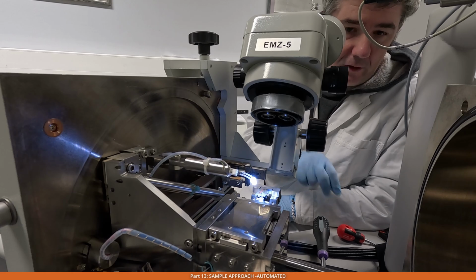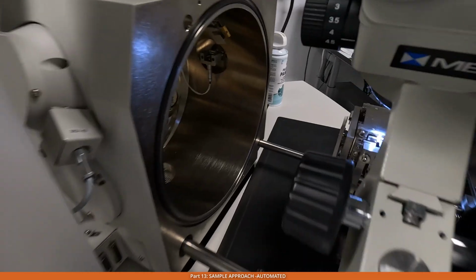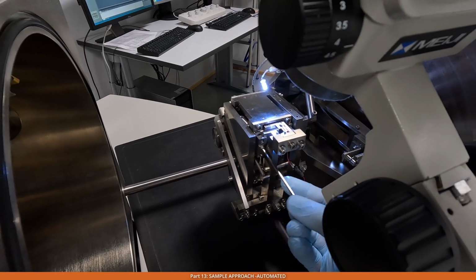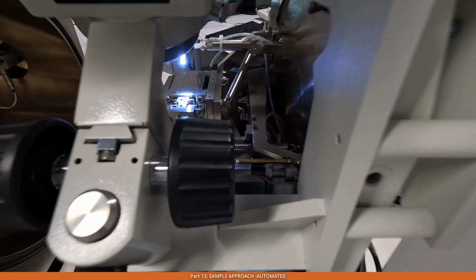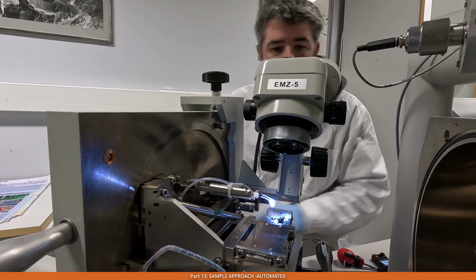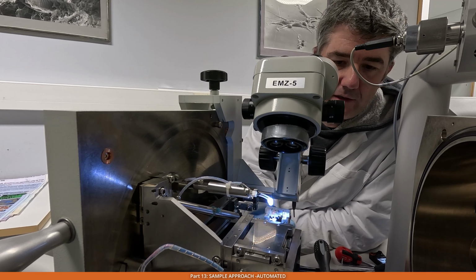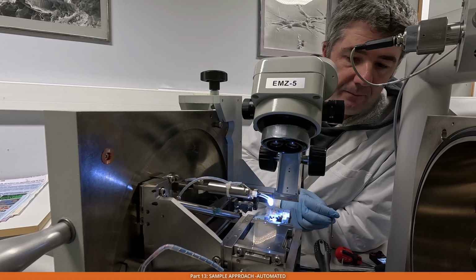Now we can lock this stage in this position. We tighten these 2 screws on the sides of the knife. One of them is this, and the other one is the similar screw on the other side. So now we can double check things. Our screw which locks the sample holder is tightened, and the 2 other screws that lock the stage are also tightened.